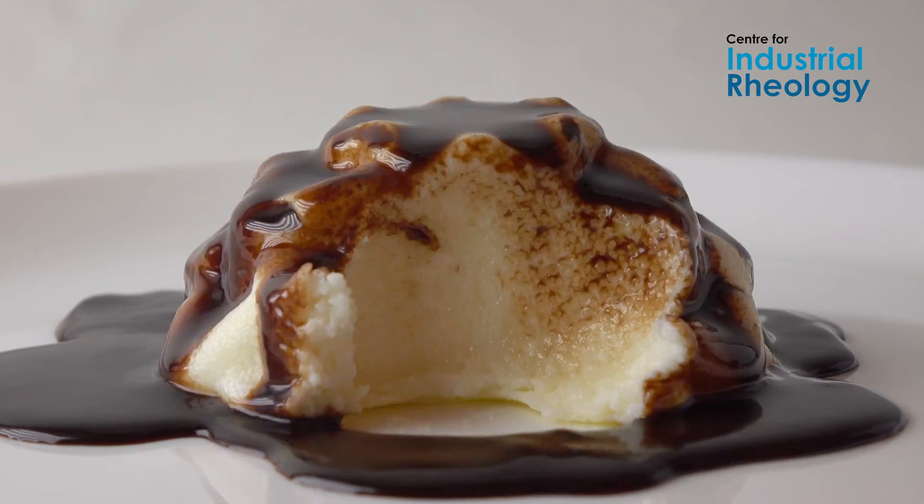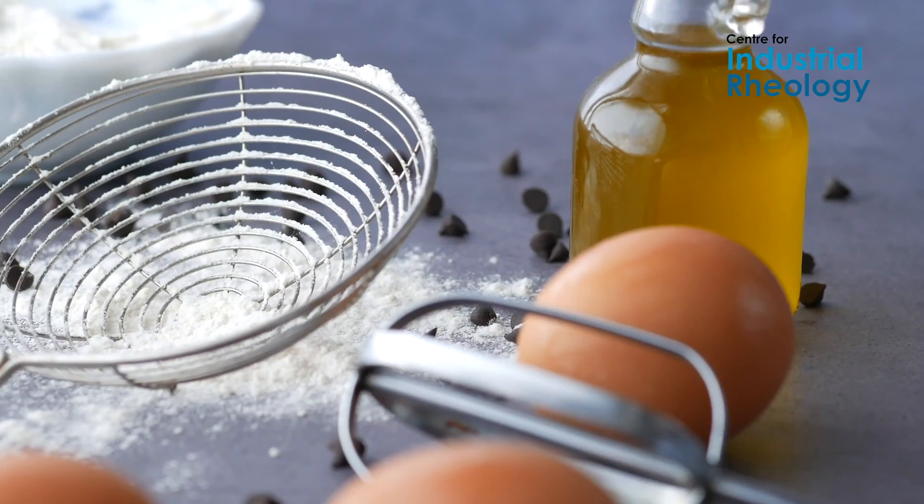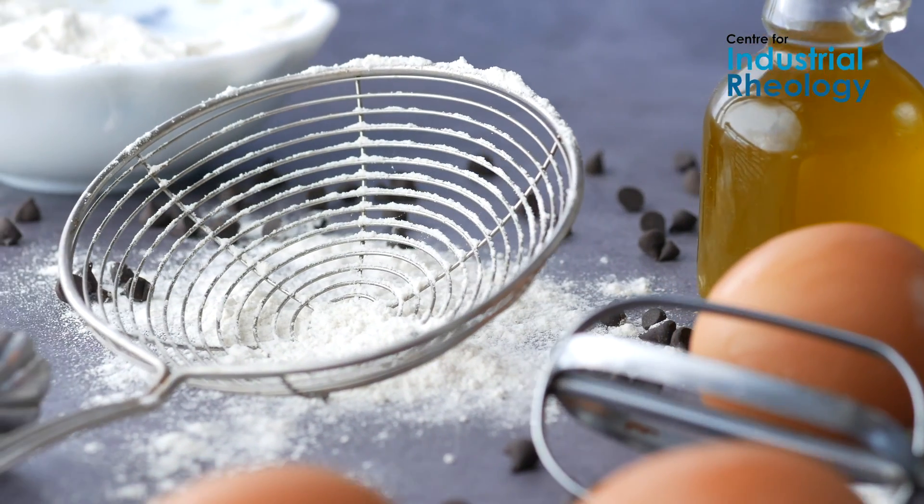The foam analyser can provide similarly useful data for a range of products including beers, mousses, egg replacements, and bakery ingredients.